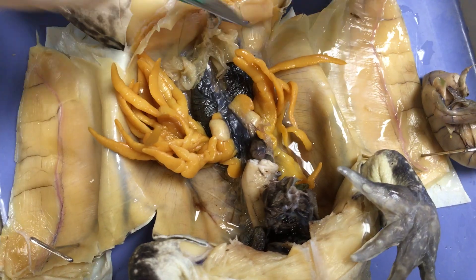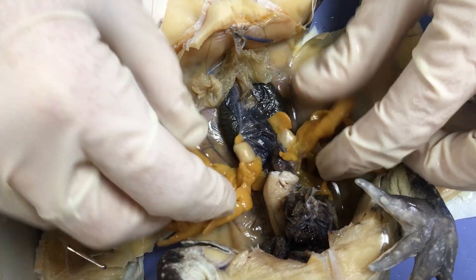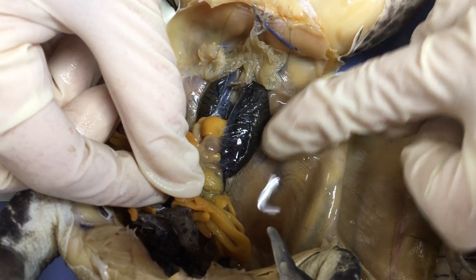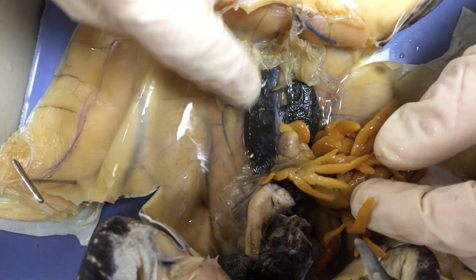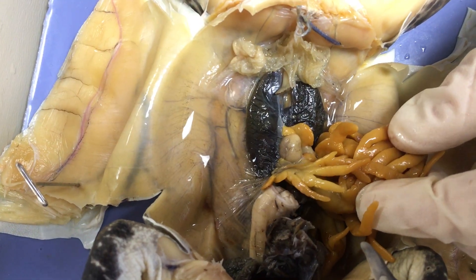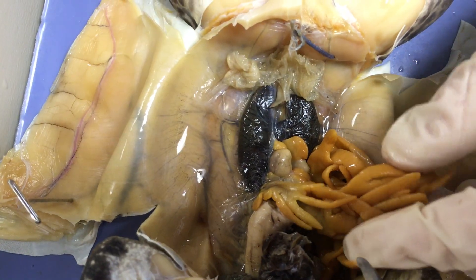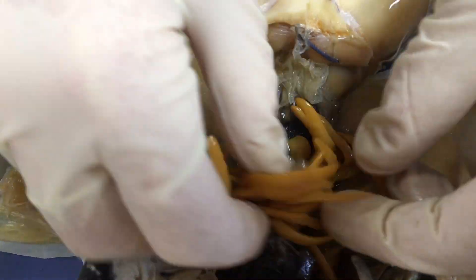Now that we've got that large intestine out of the way, let's move these fat bodies to see this structure that runs along the back of the frog. We've got one on each side, so they're paired. These are the frog's kidneys. Just like in humans, they are responsible for filtering the blood and producing urine. They are connected to the cloaca to release that liquid waste product out of the frog.